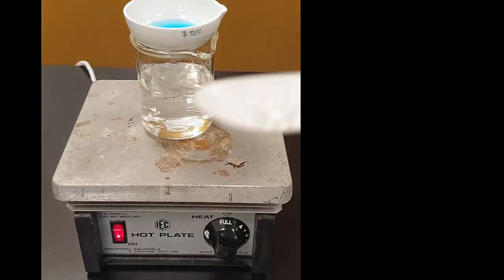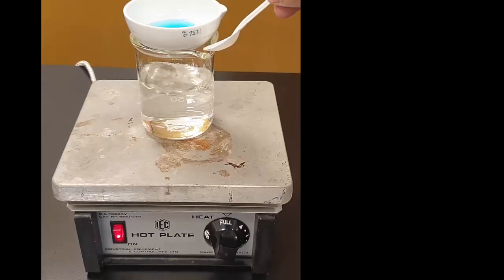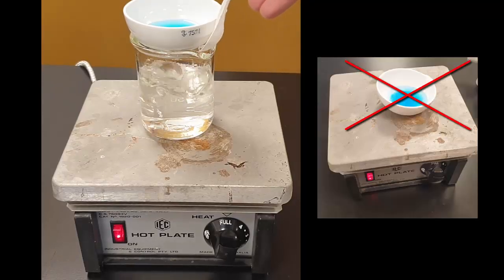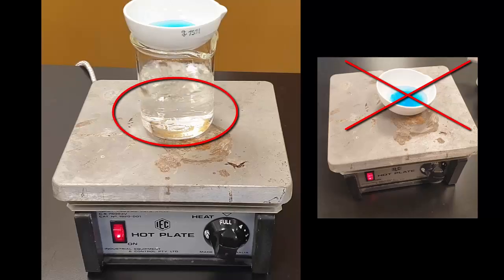So when you recrystallize, this is the textbook technique that shows you how to do it. Instead of heating it up directly and getting the splattering of the liquid, which will end up having sulfate everywhere, this is like a water bath. The water here is at 100 degrees, and it makes sure that it's a more gentle heating and it doesn't go over 100 degrees.